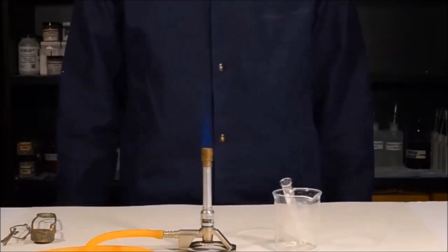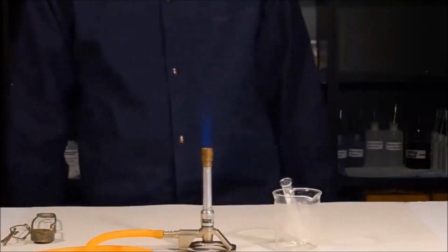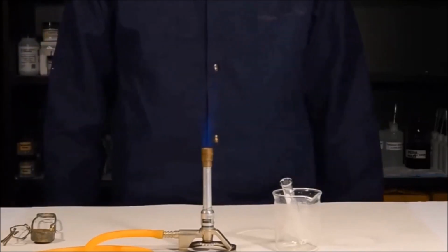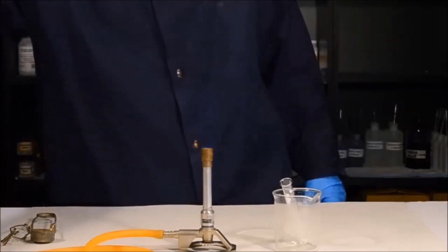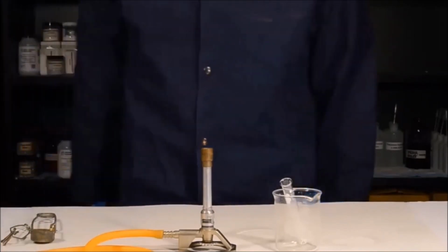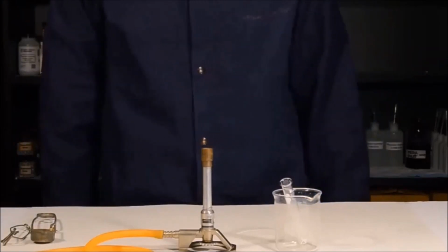One of the single most dangerous things you're going to use in the lab is the natural gas. This is because if it's left on, it could literally cause an explosion. So it's very important that when you're done using your Bunsen burner, that you turn the gas off at the bench completely. In fact, before you leave the lab, you should triple check that you have turned your gas off to make sure that everyone in the lab is safe.